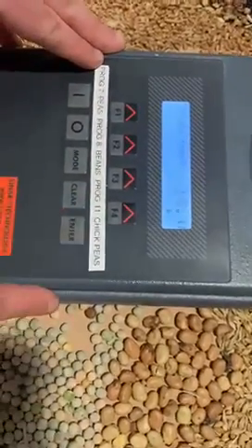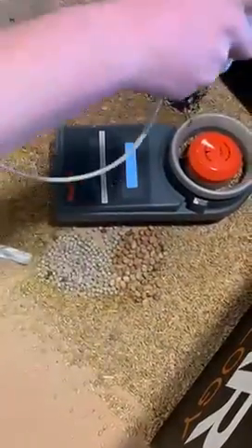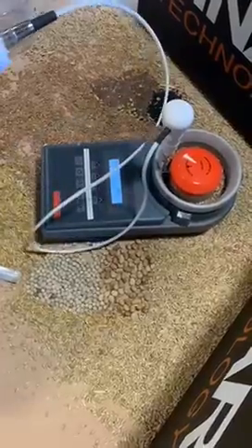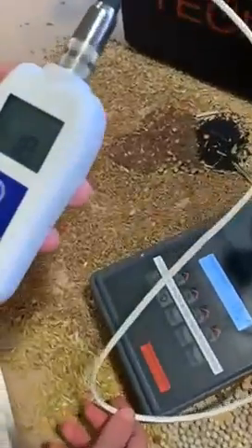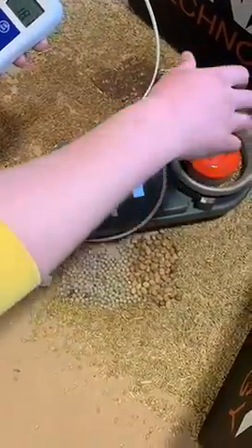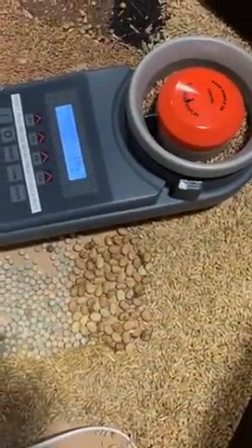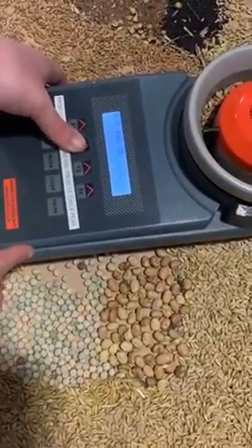Press enter to confirm that. Next is the temperature. Using a temperature probe, we place this into the machine as close to the thermistor as possible and take a reading. This is currently reading 18.1, so then we can put this into the machine. Remove the thermistor.